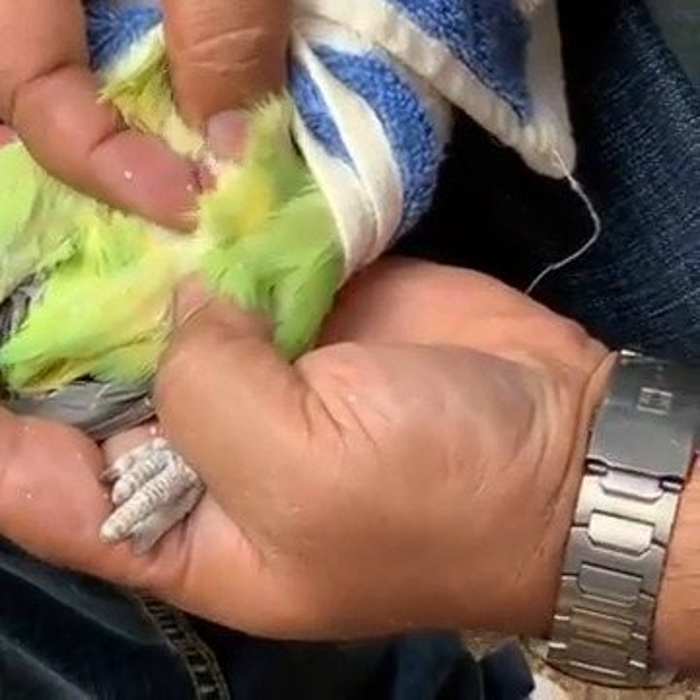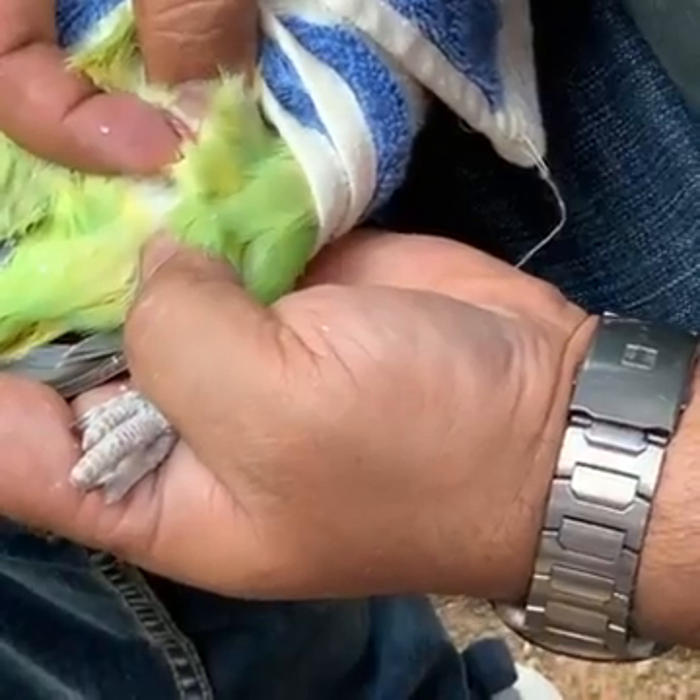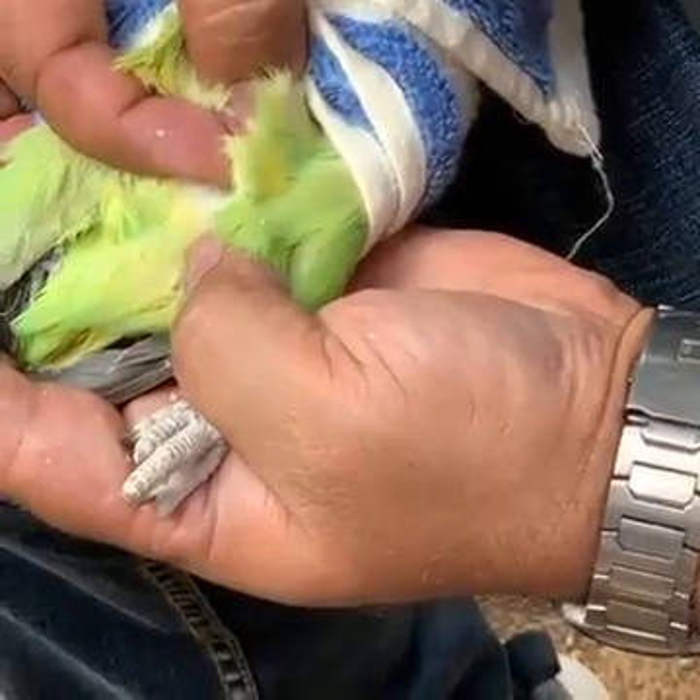Now when you see something a little white — it doesn't have that much — so it has not yet developed. But that's the way to squeeze it a little bit.